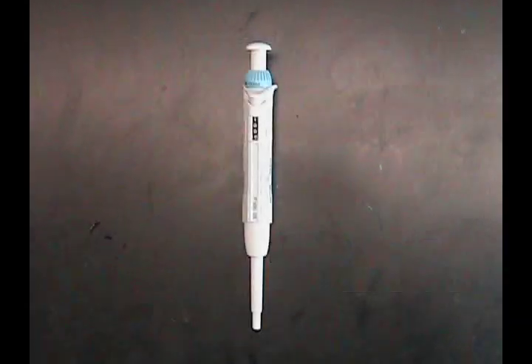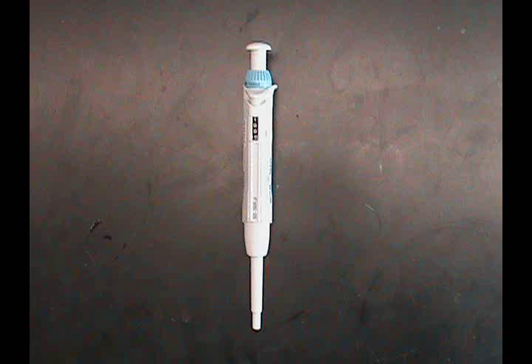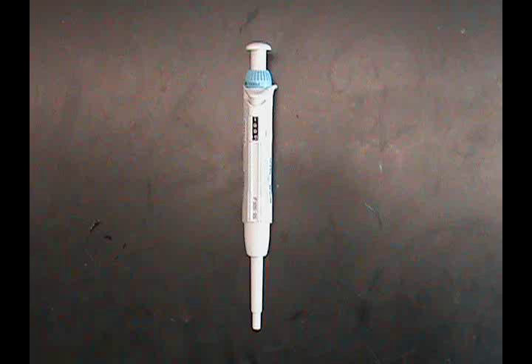The automatic micropipette is used to accurately transfer small volumes of liquids. These pipettes can be set to transfer any volume within its range, making sure not to go below the recommended range as this will introduce larger error.